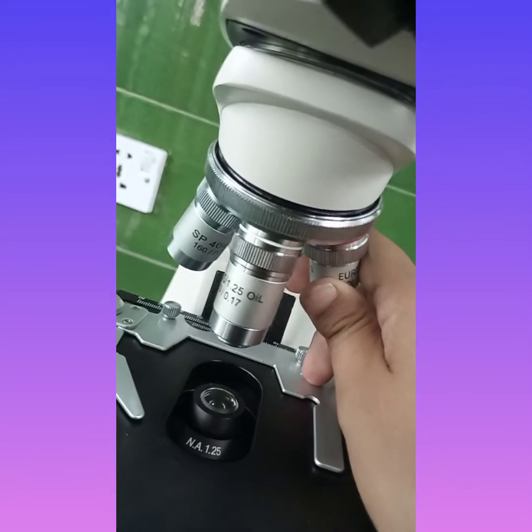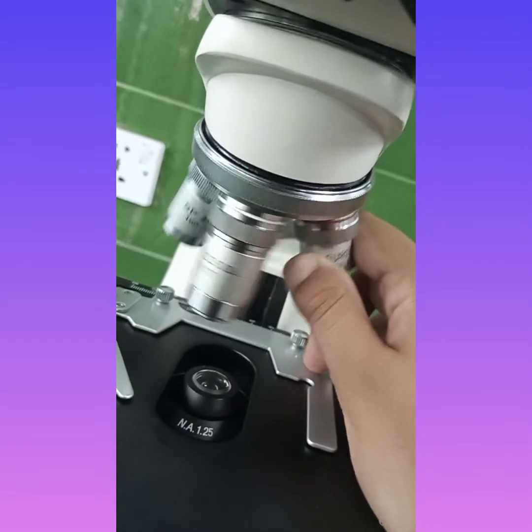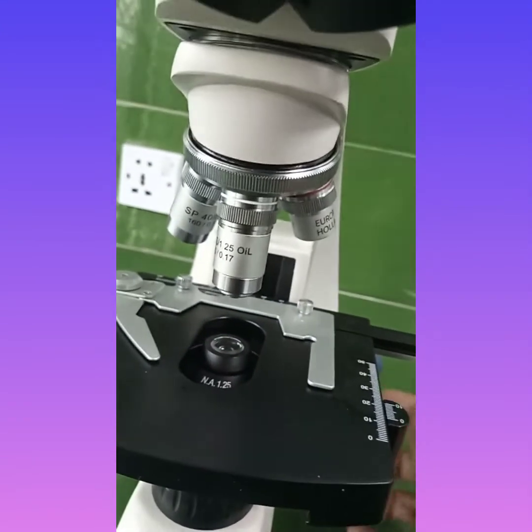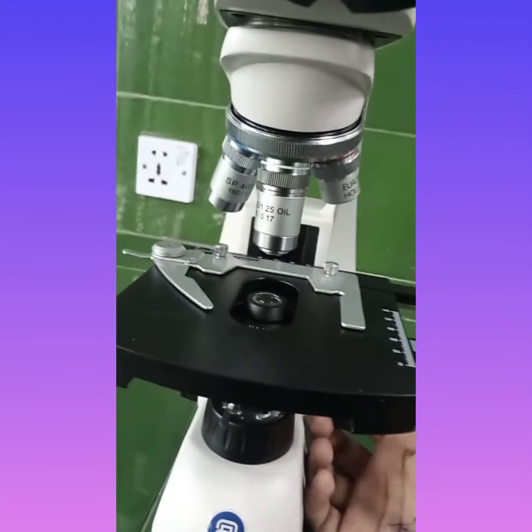This wheel to which the objective lenses are attached is movable, and you can move it according to your need, depending on the magnification under which you want to see your results. The most commonly used magnification is the oil immersion magnification.